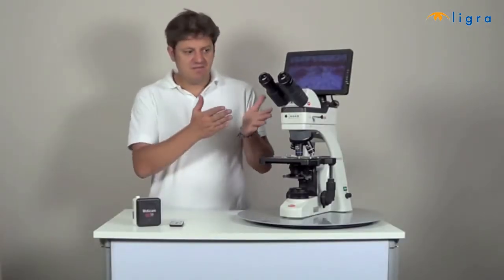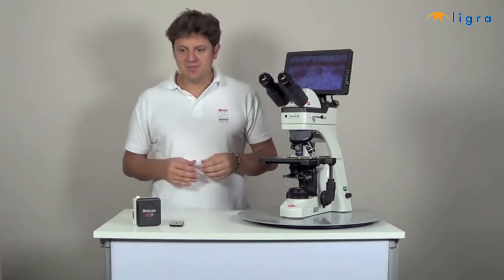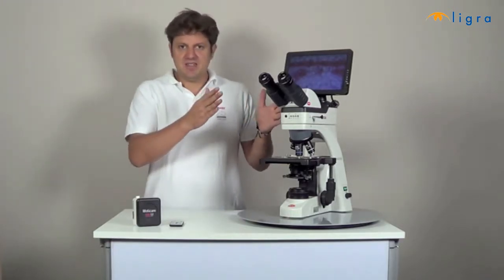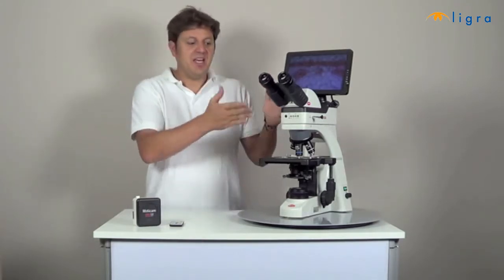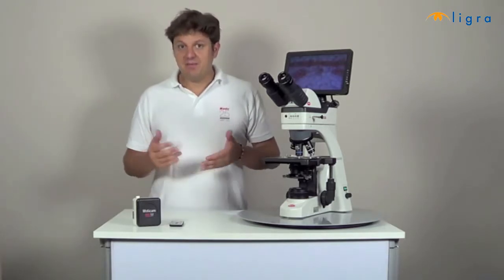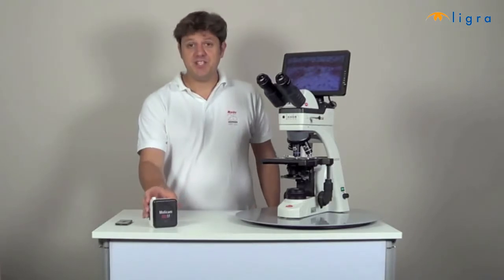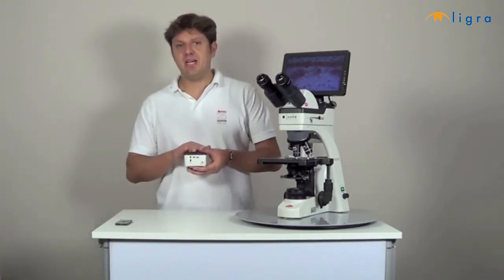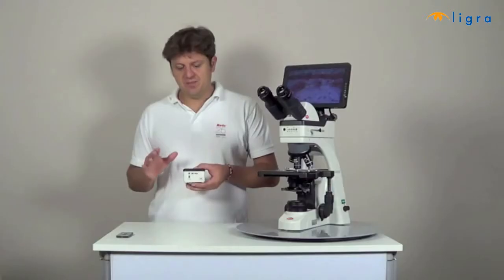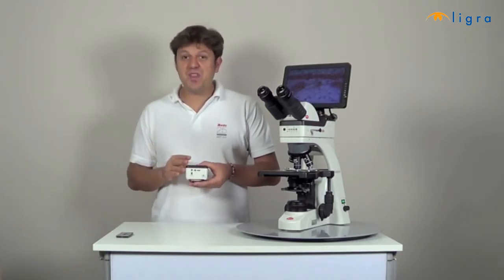Moticam 580 and 580 INT are high-definition cameras with several output options. Both cameras have the same technical characteristics, but the difference is that the 580 INT is meant to be integrated in a BA Elite microscope, while the 580 can be mounted on any microscope through the C-mount. The main feature of the Moticam 580 is the HDMI output, which transfers images to a flat screen or a projector. It is a really fast live image of 30 frames per second and a resolution of 1080 lines.